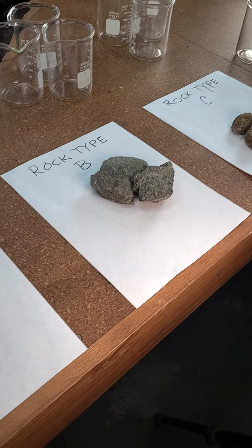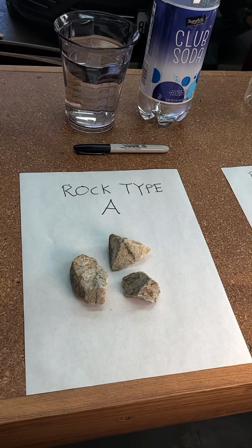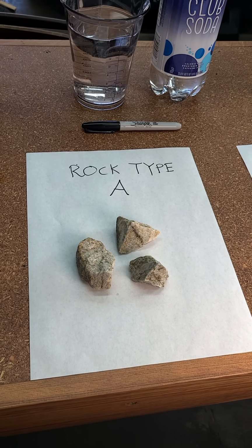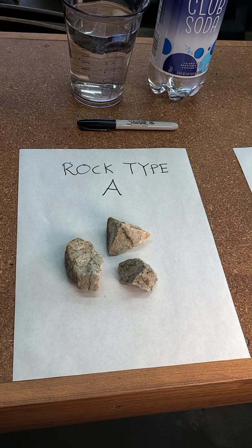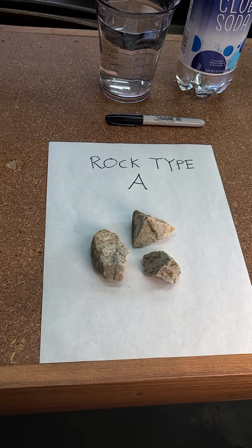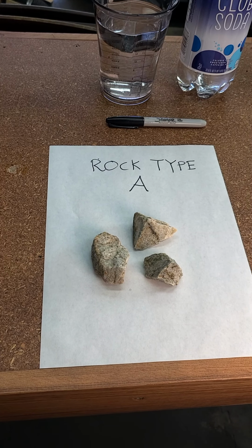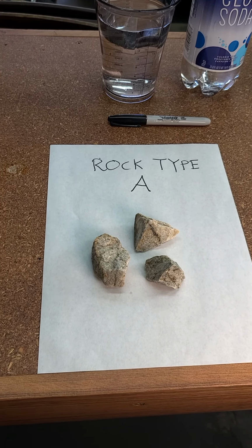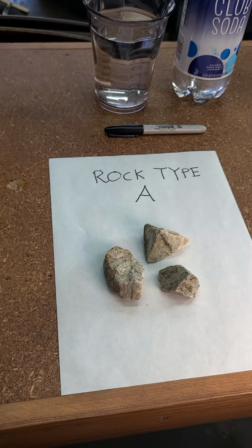So we're going to actually treat each of these 3 different types of rocks to 3 different treatments. In one part, we're going to determine which rock is the most porous. We know that if a rock can take water into itself, if it's got cracks or pores, and water can go into the rock, then if climate begins to act on that rock, like if the temperature drops and the water inside freezes, that will put a force on that rock that'll help split it apart and break it down, which is what we want to happen if we're trying to make soil out of these rocks.